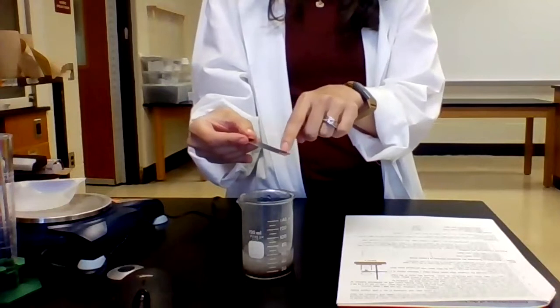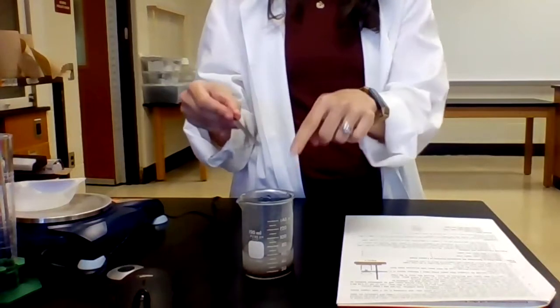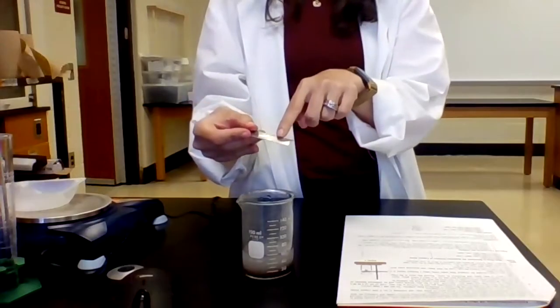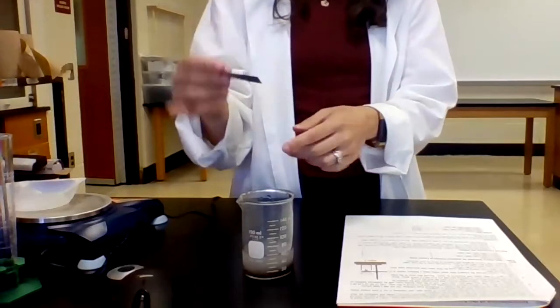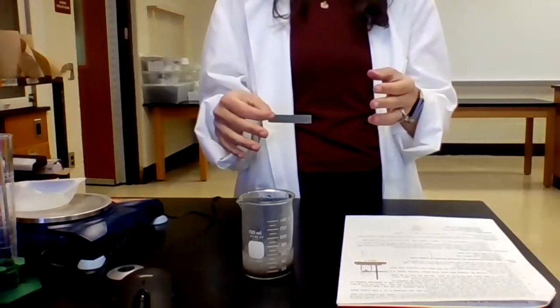If the reddish brown copper metal starts to form on this zinc, that means that there is still unreacted copper oxide that, once I add the zinc, it reacts with. And we need all of that copper oxide to react. That's our limiting reagent. The zinc that we added was excess zinc to ensure the reaction went to completion.